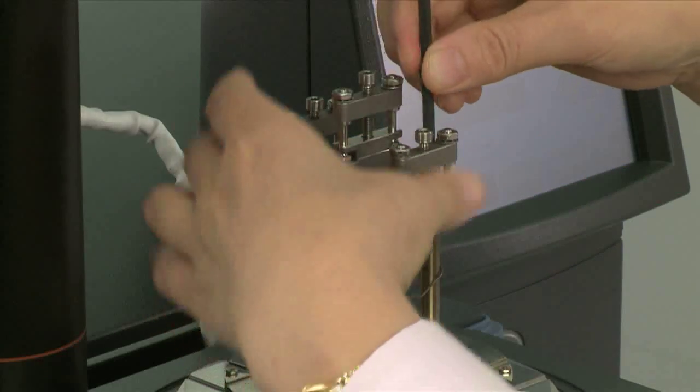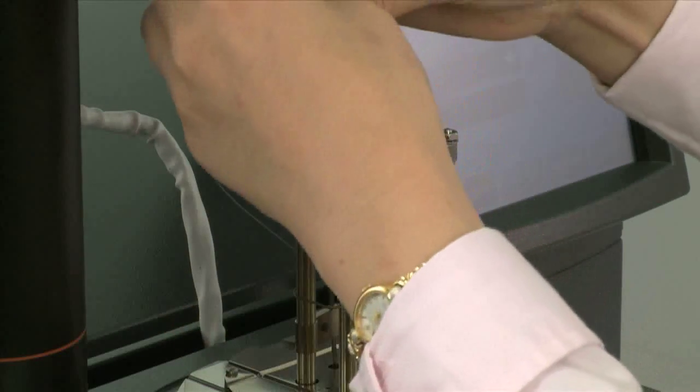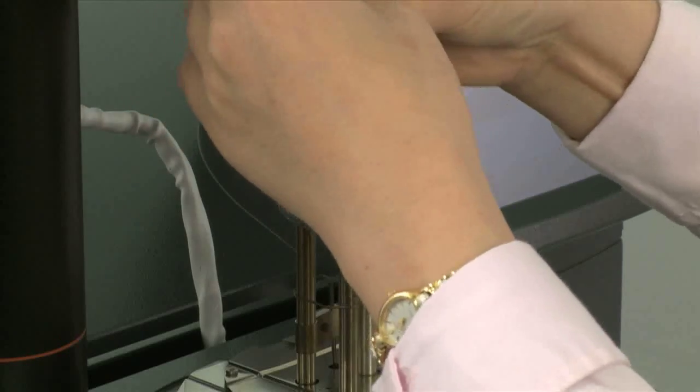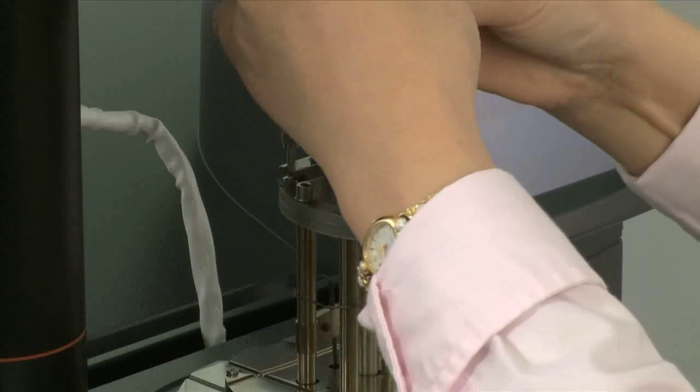Tighten all the screws with the Allen key that's provided in your clamp kit. Make sure to not bend the thermocouple.